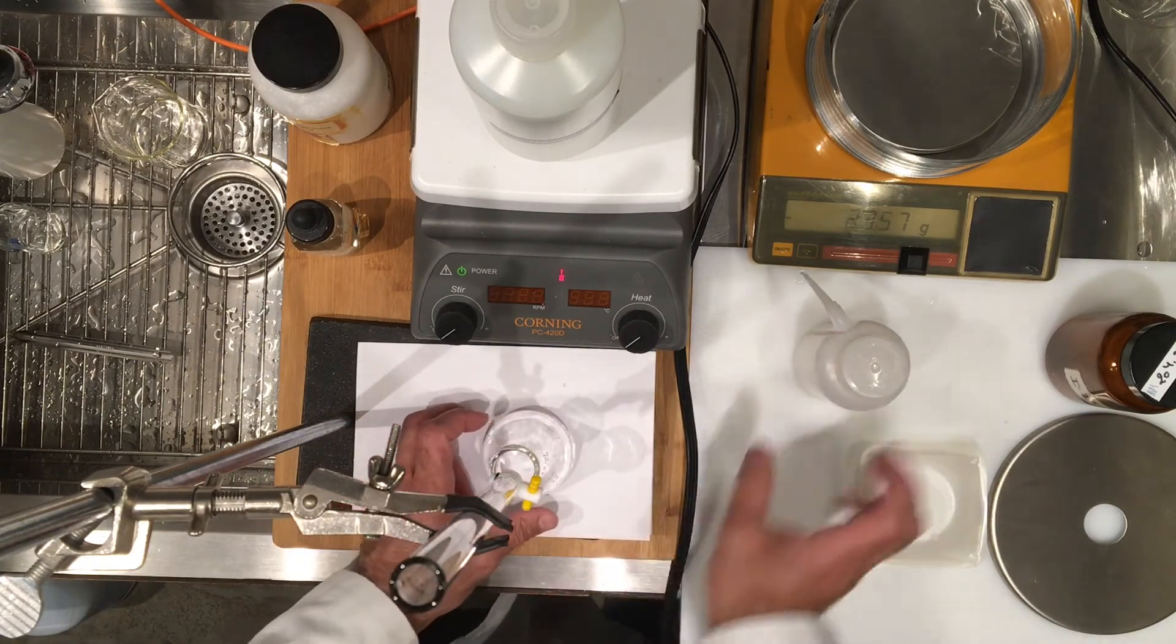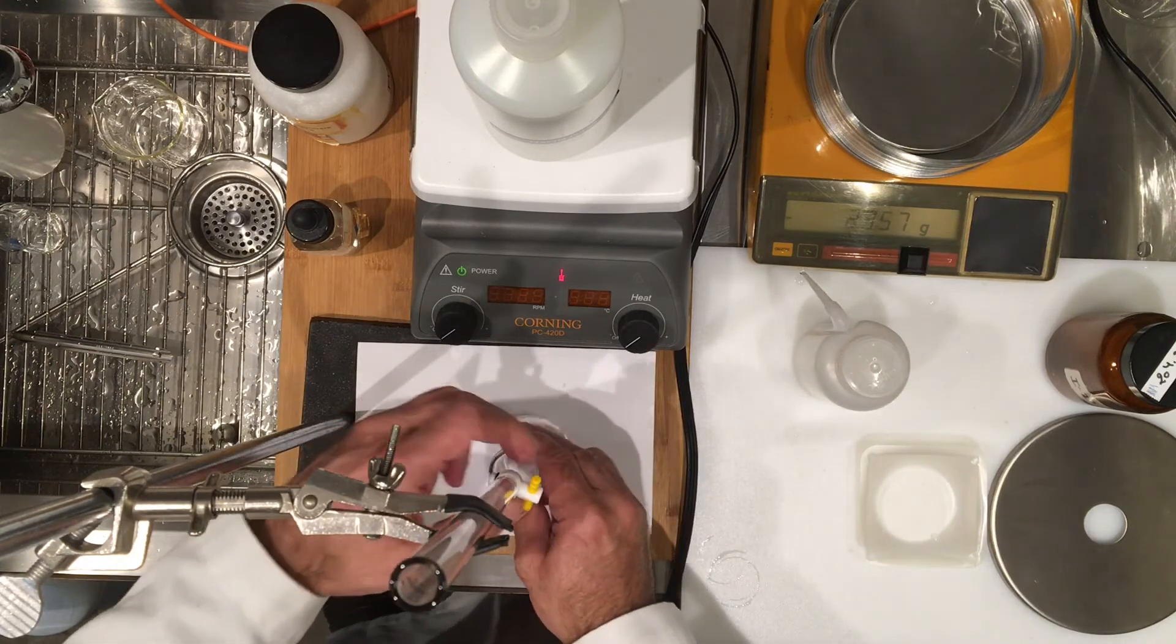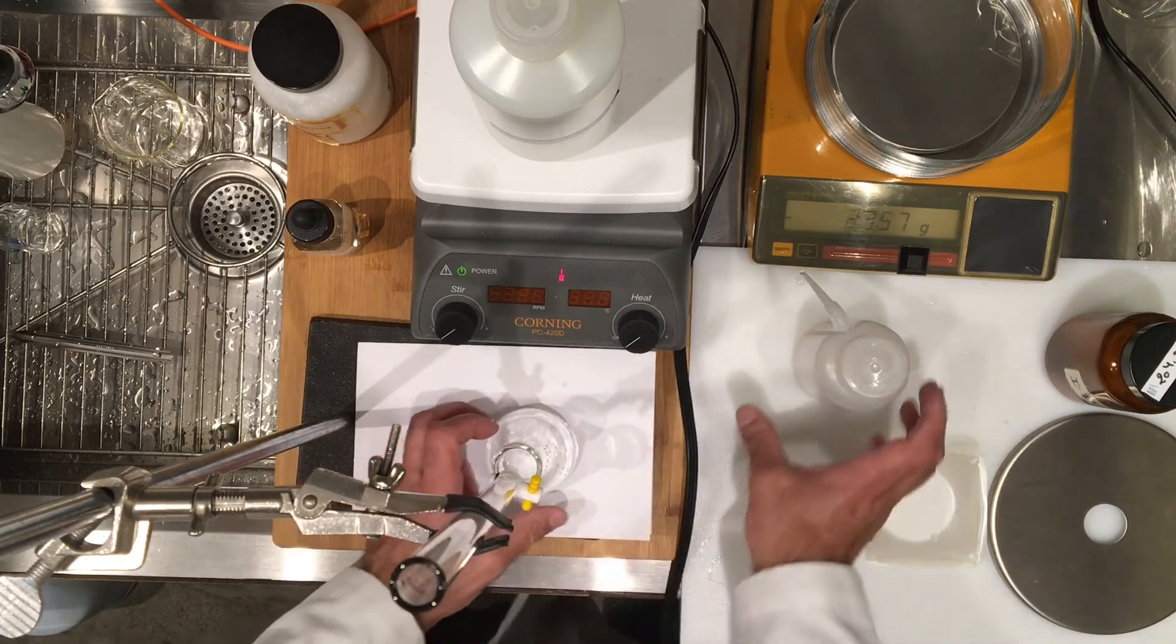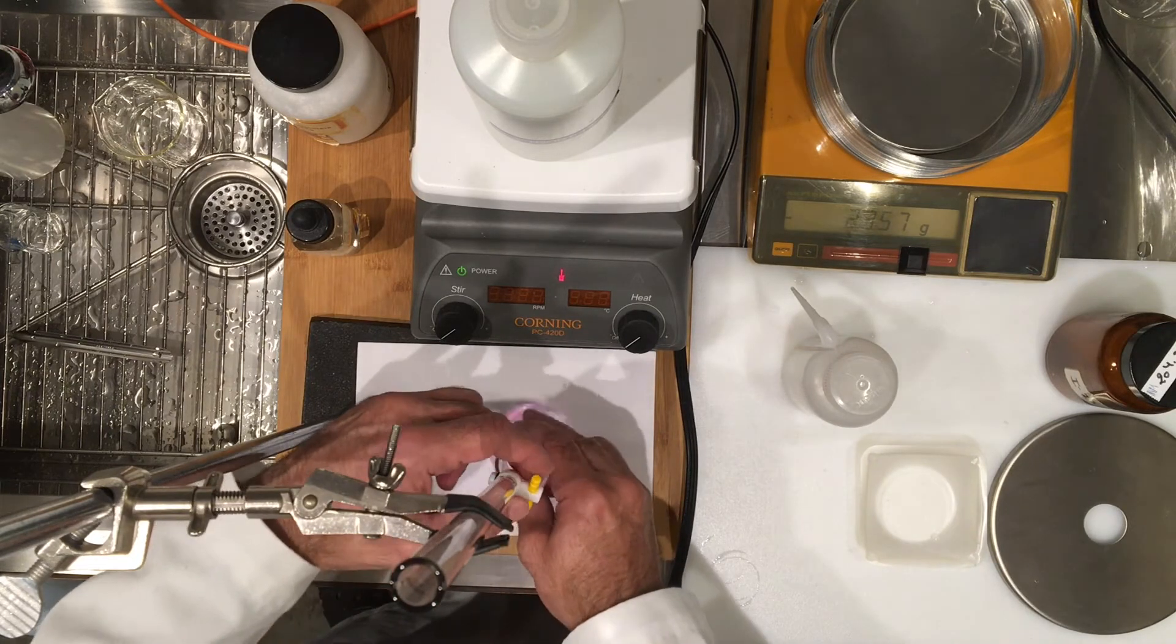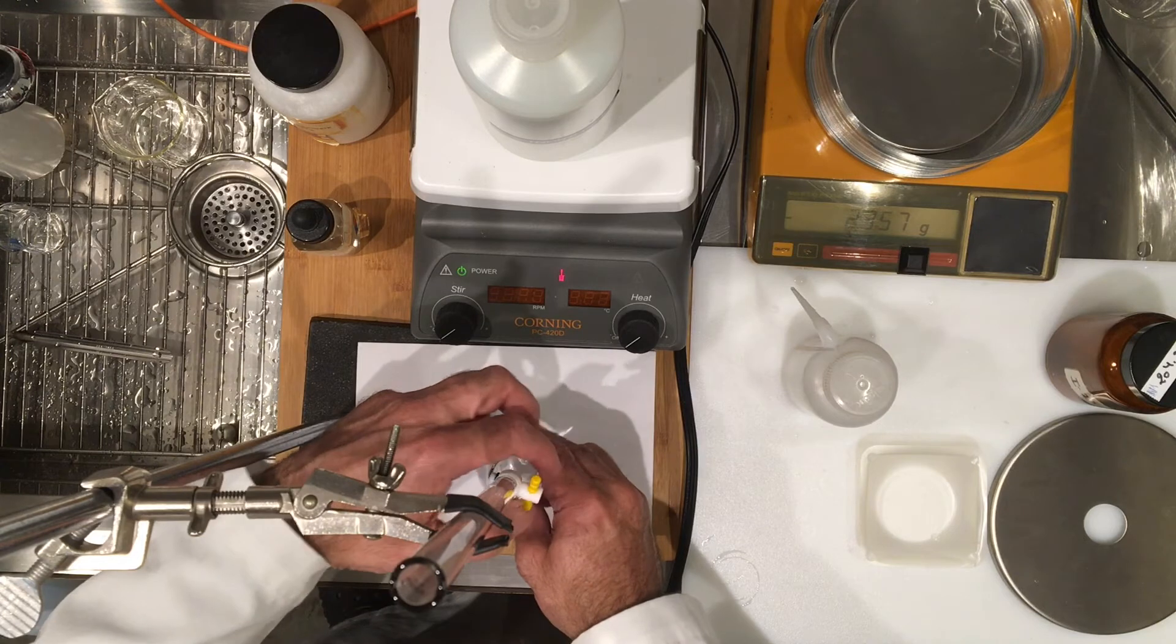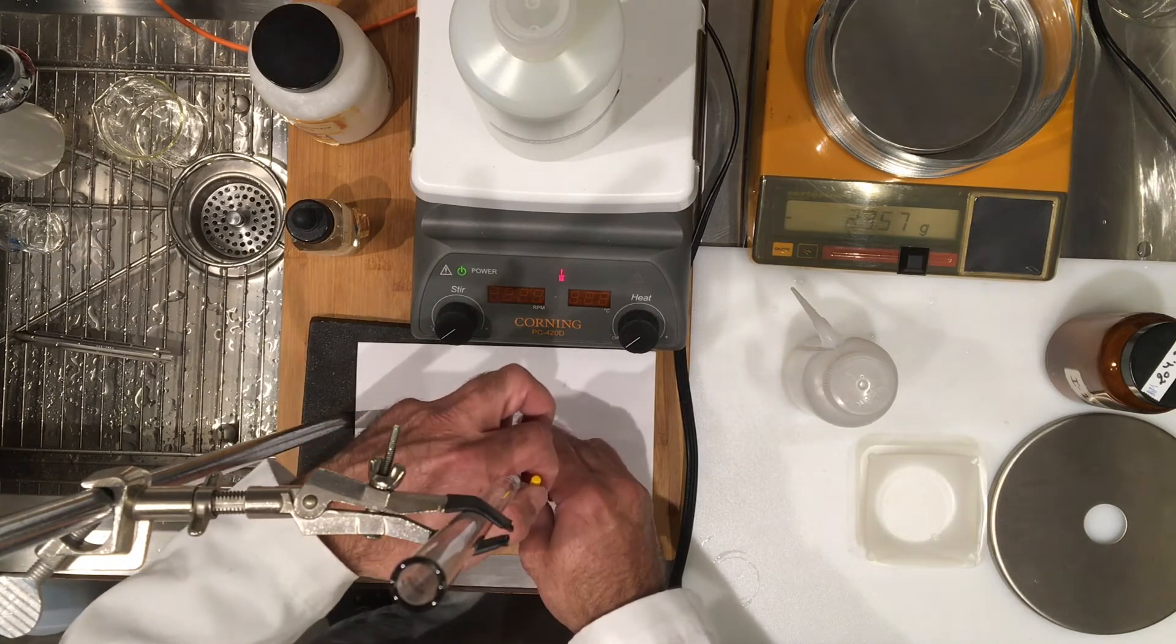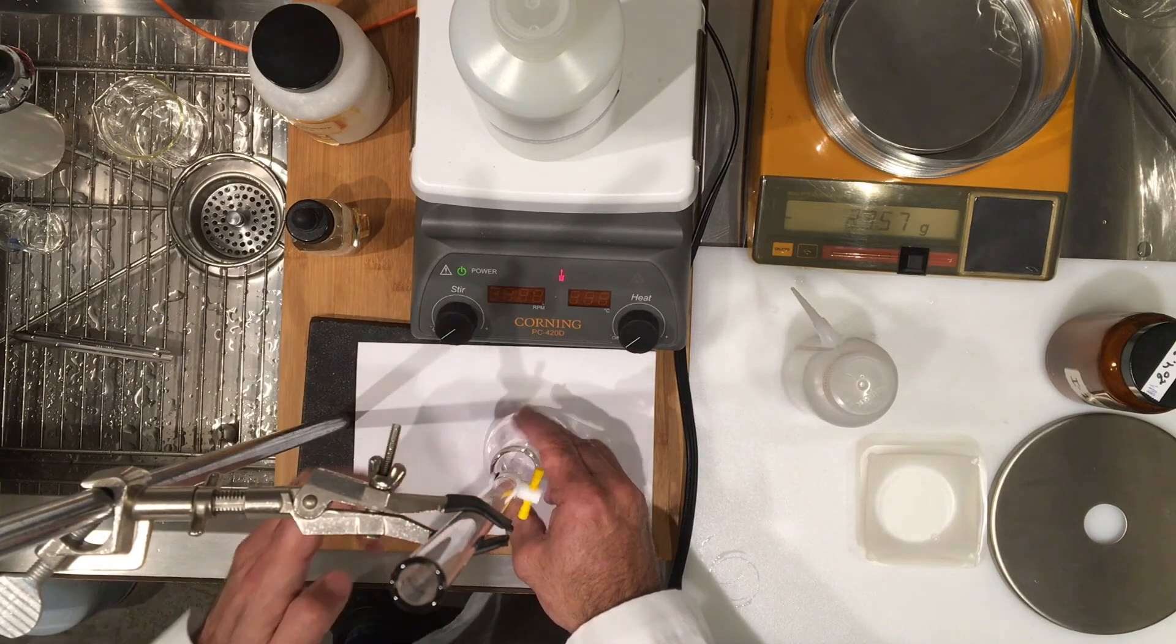At this point I'm going to watch the sidewall. I think I'm really close but you can see that one drop makes a big difference. I'm probably only like a few drops away. Here it is, every drop makes a huge difference, so I'm just going to let it fall and I bet you this may be it because I already see my slight faint pink color. It's hard for you to see it but there's a hanging drop on the tip of this burette.